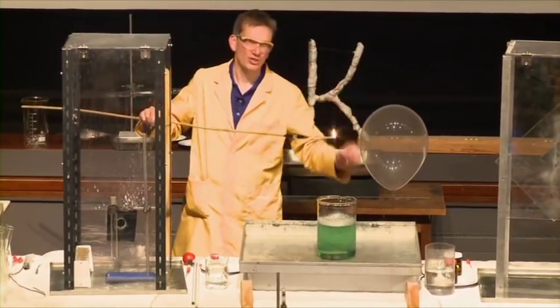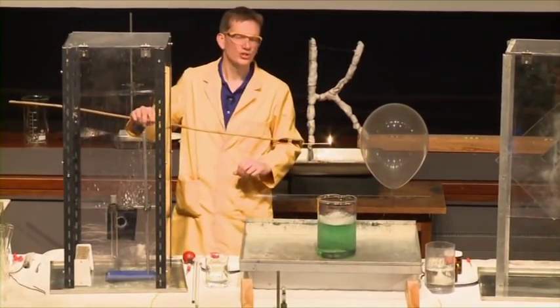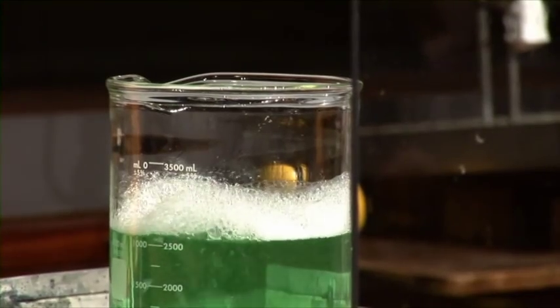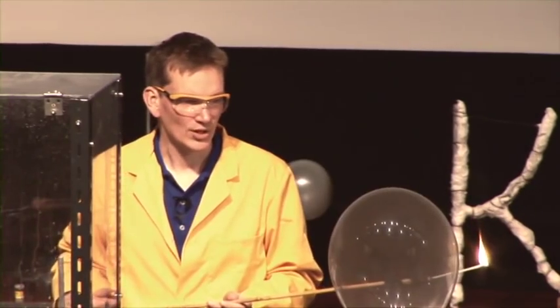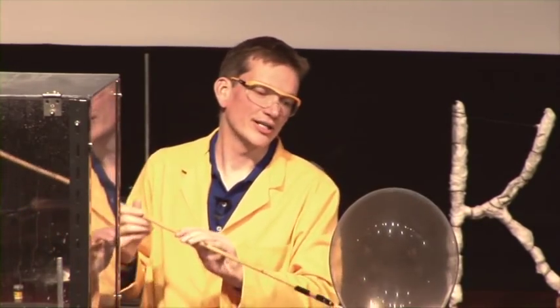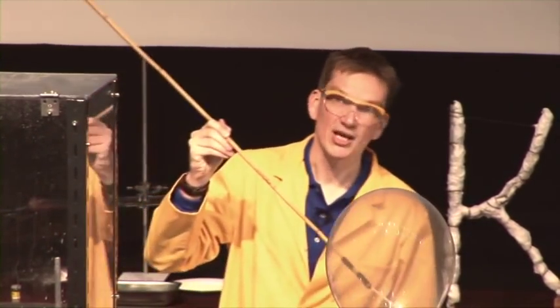So remember, sodium hydride reacts with water to form hydrogen gas. And the hydrogen gas is, of course, flammable. There we are. Now, so just generate a few more. And so as I say, this was actually used to power a taxi using the hydrogen gas here as the fuel.